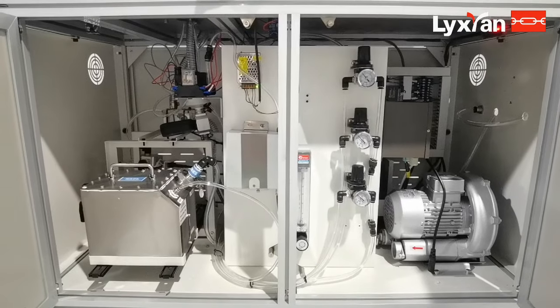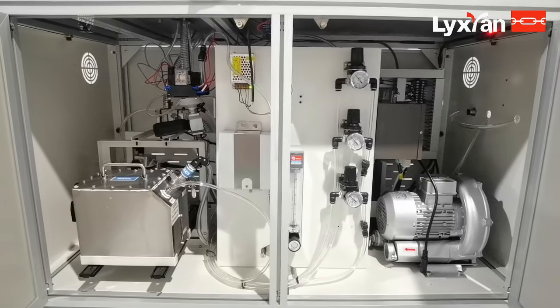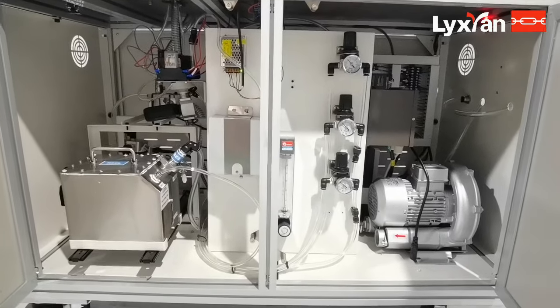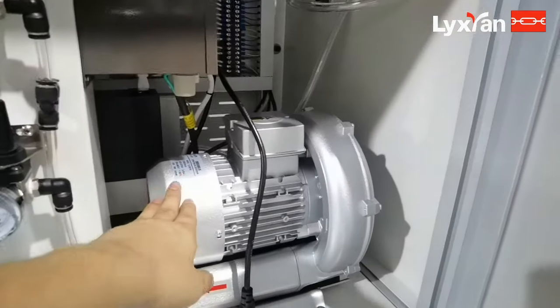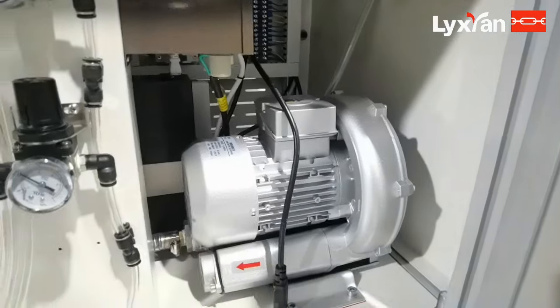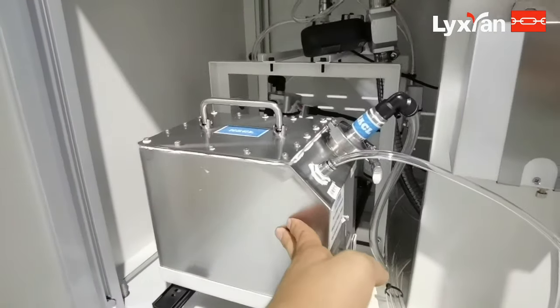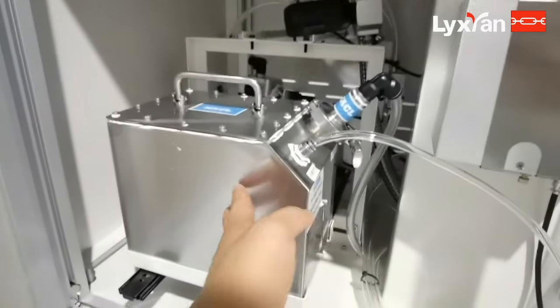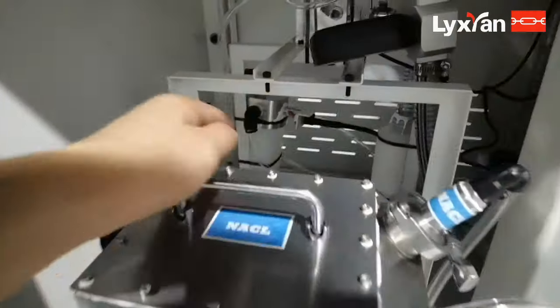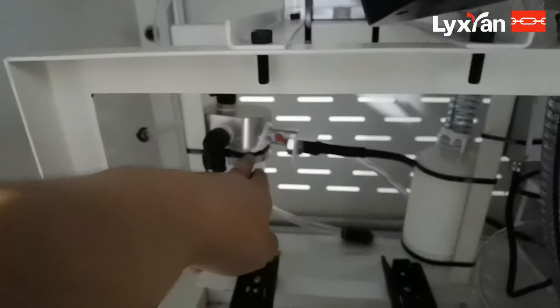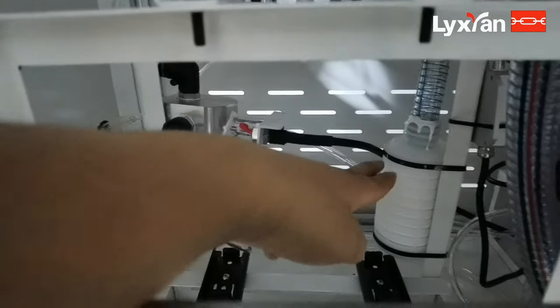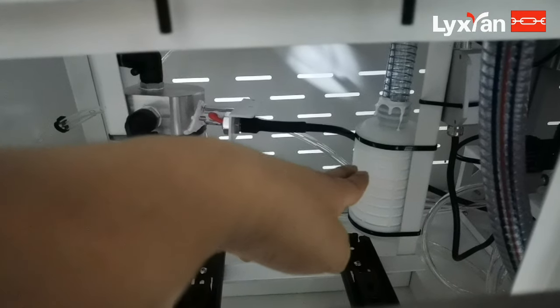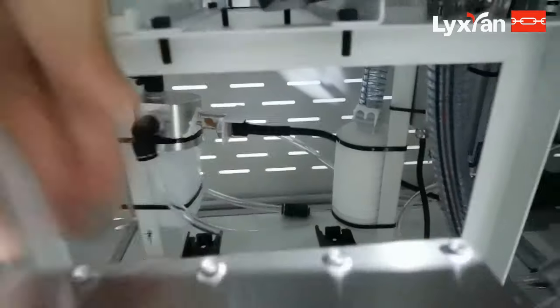Now we introduce the machine working theory. This is a vacuum, this is a generator, an aerosol generator. And here is a heater, and here is a neutralizer.